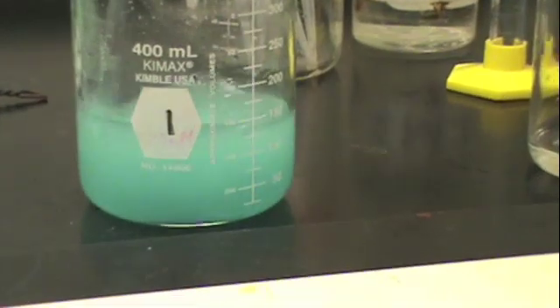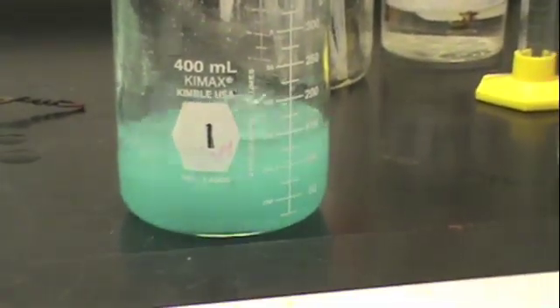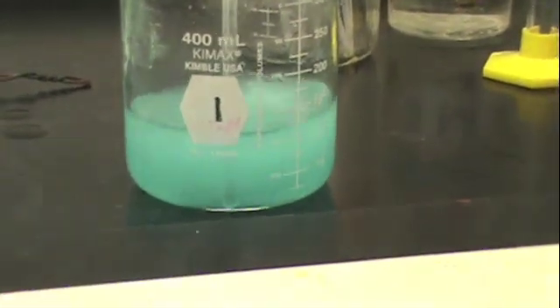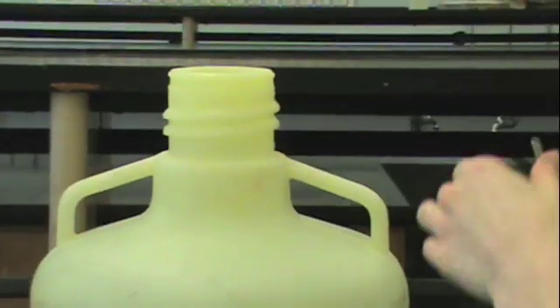You should record the appearance of these bubbles in your datasheet. You will notice that as we stir vigorously, some of the blue color will begin to disappear as we form copper precipitate in the bottom of the beaker. After stirring for several minutes, you will notice quite a large amount of copper precipitate.